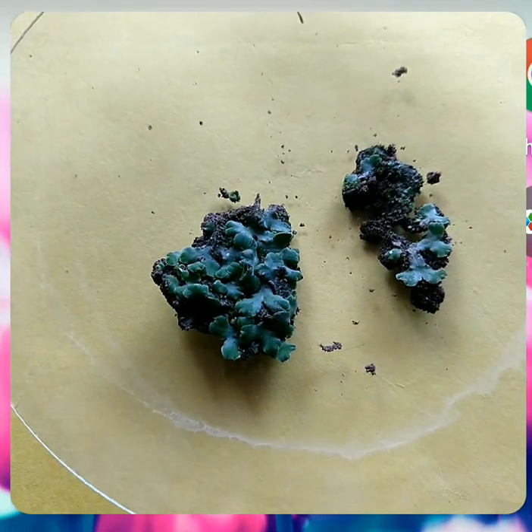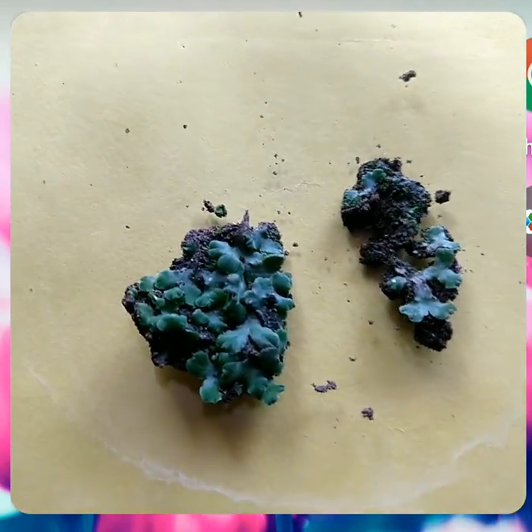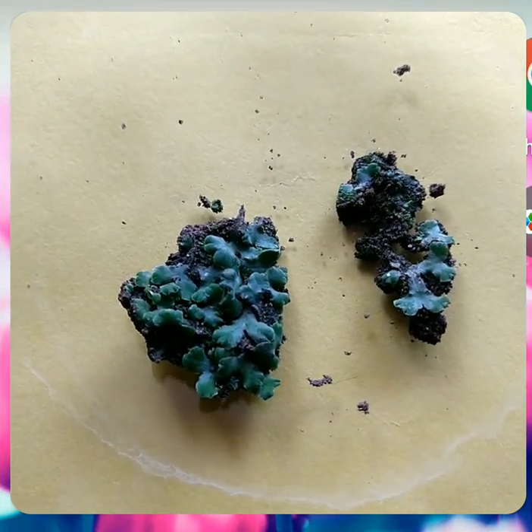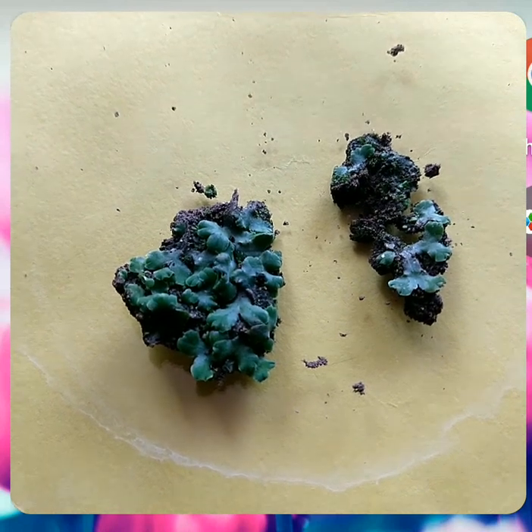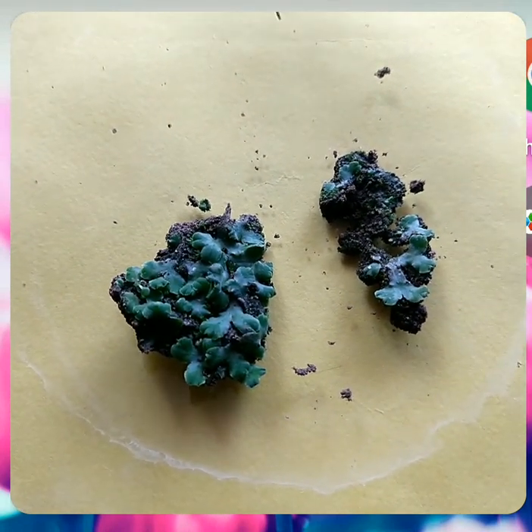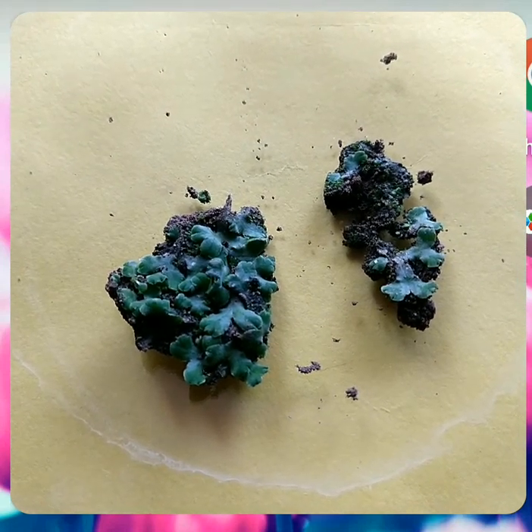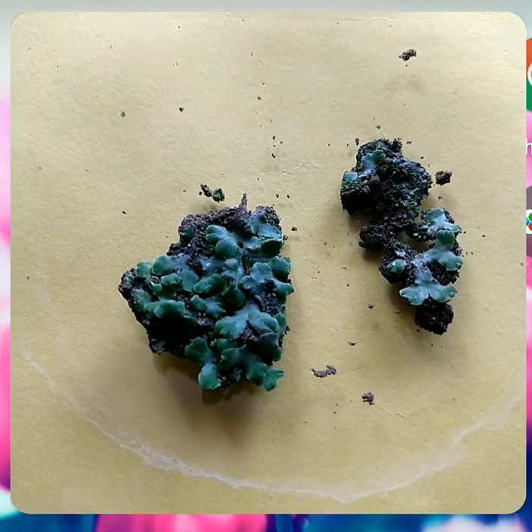All these specimens come under division Bryophyta. As you know, bryophytes are non-vascular cryptogams, and they are also known as amphibians of the plant kingdom. In this group, the plant body is the gametophyte.